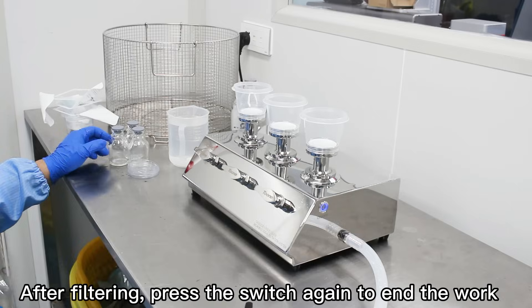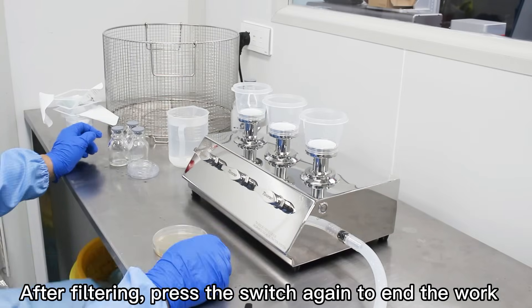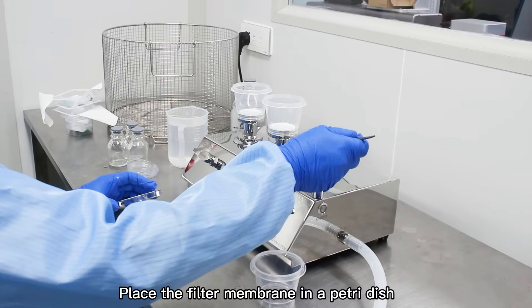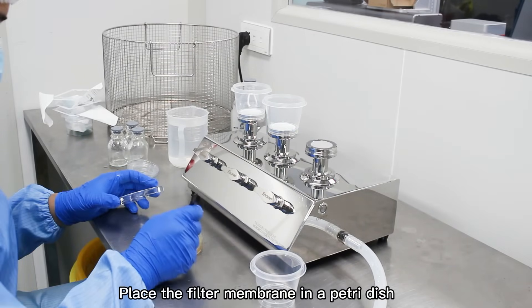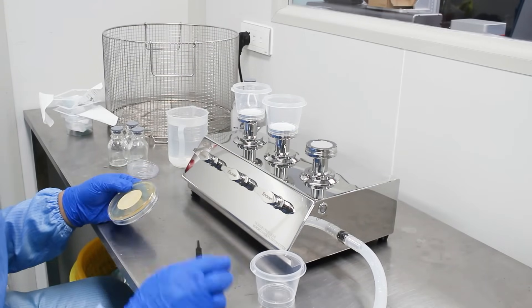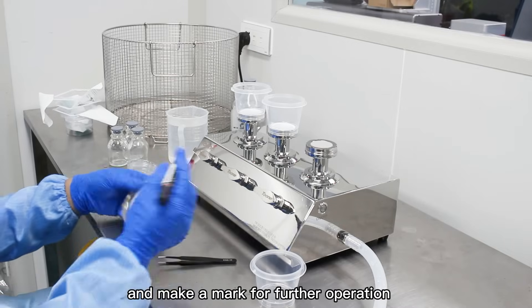After filtering, press the switch again to end the work. Carefully remove the filter cup. Place the filter membrane in a petri dish and make a mark for further operation.